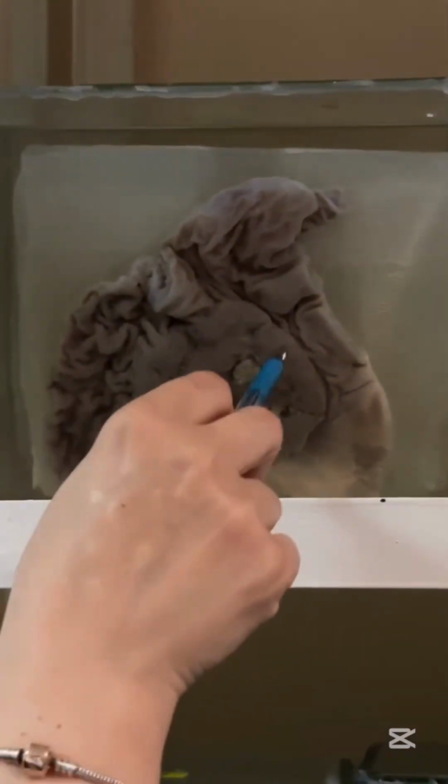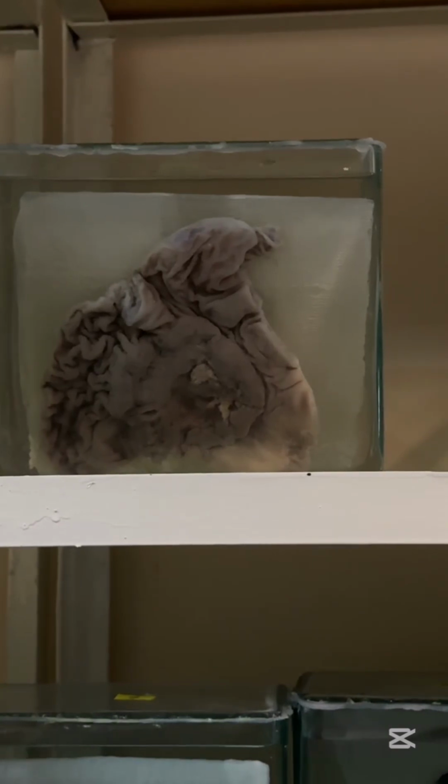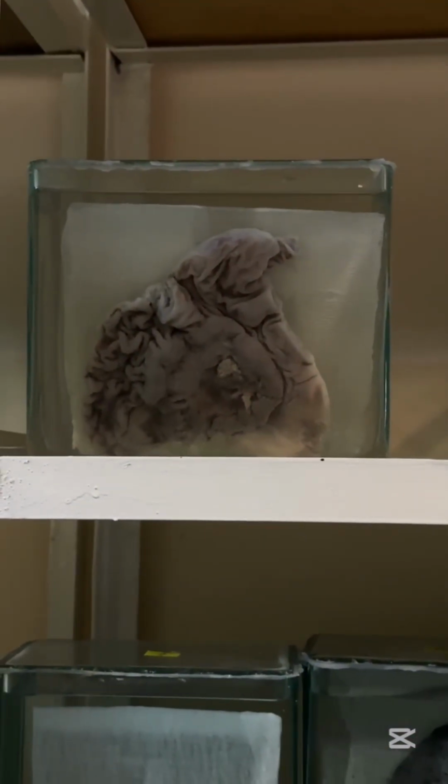This one again, stomach. You can see part of the stomach. A large tumor in the middle, that is carcinoma of the stomach. In the middle you can see a secondary focus of necrosis, so that is ulcerative carcinoma because of ulceration in the middle. Histologically, that is adenocarcinoma because it is glandular epithelium. Again, it spreads to regional lymph nodes first of all, after that maybe hematogenous spreading to other organs.